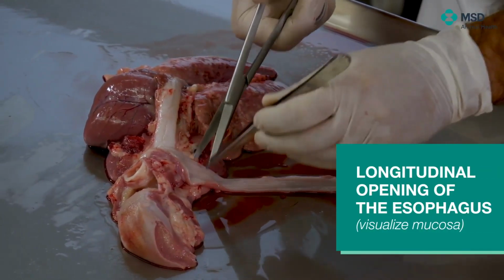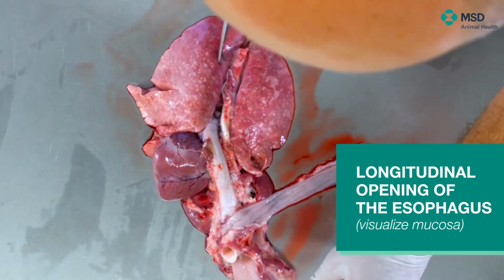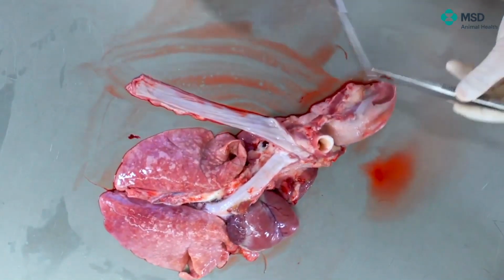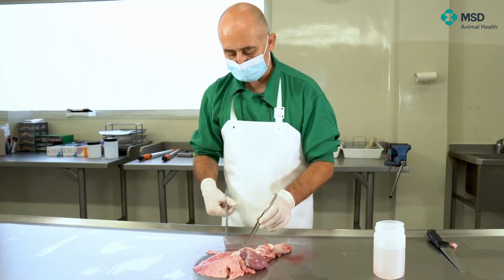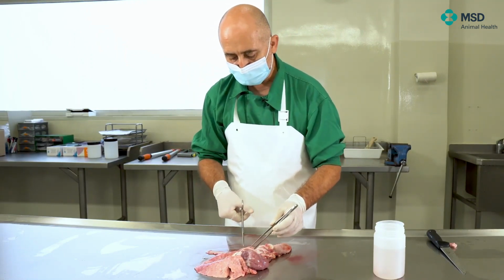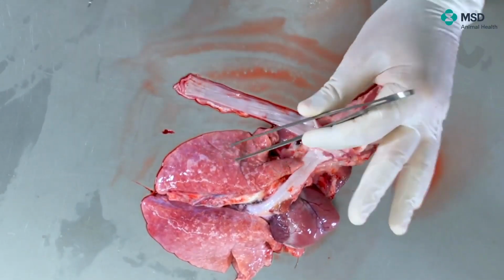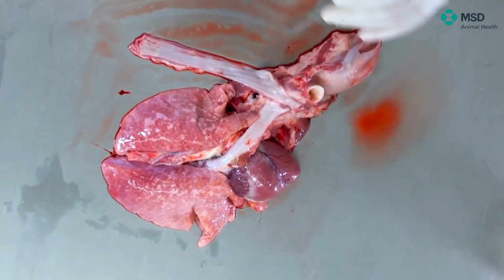So we can open from the caudal part or from the cranial part. This is irrelevant, but we can open it longitudinally. And we can see that the mucosa is white, is absolutely normal. There's no alterations, there are no different areas in color or something like that. So this is absolutely a normal one.